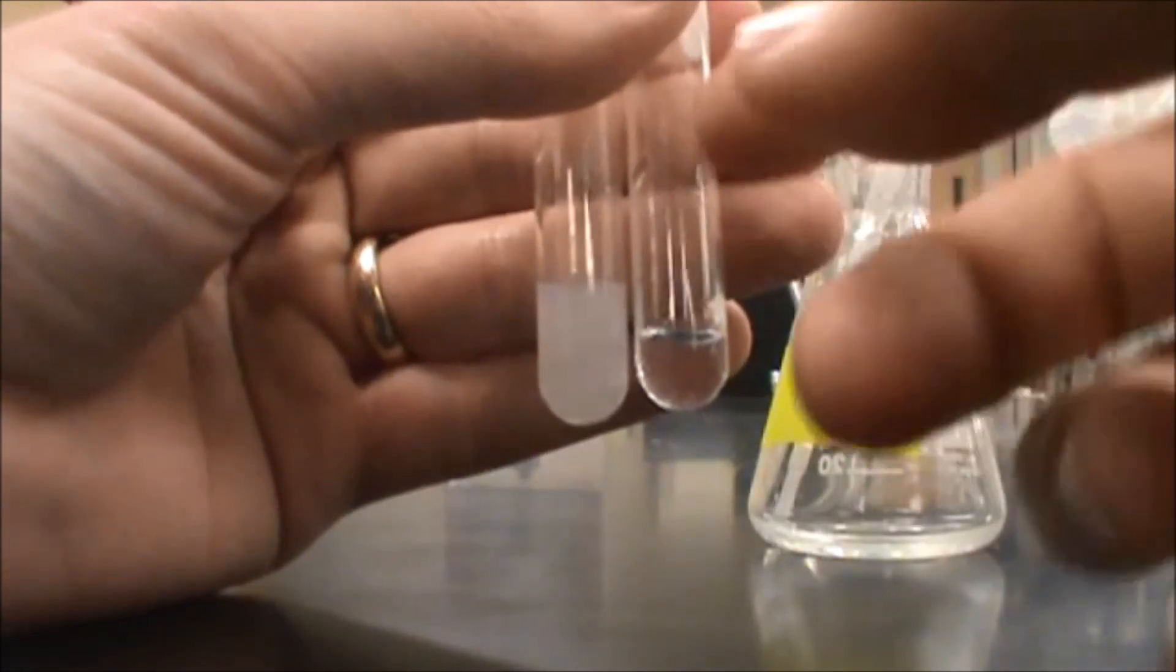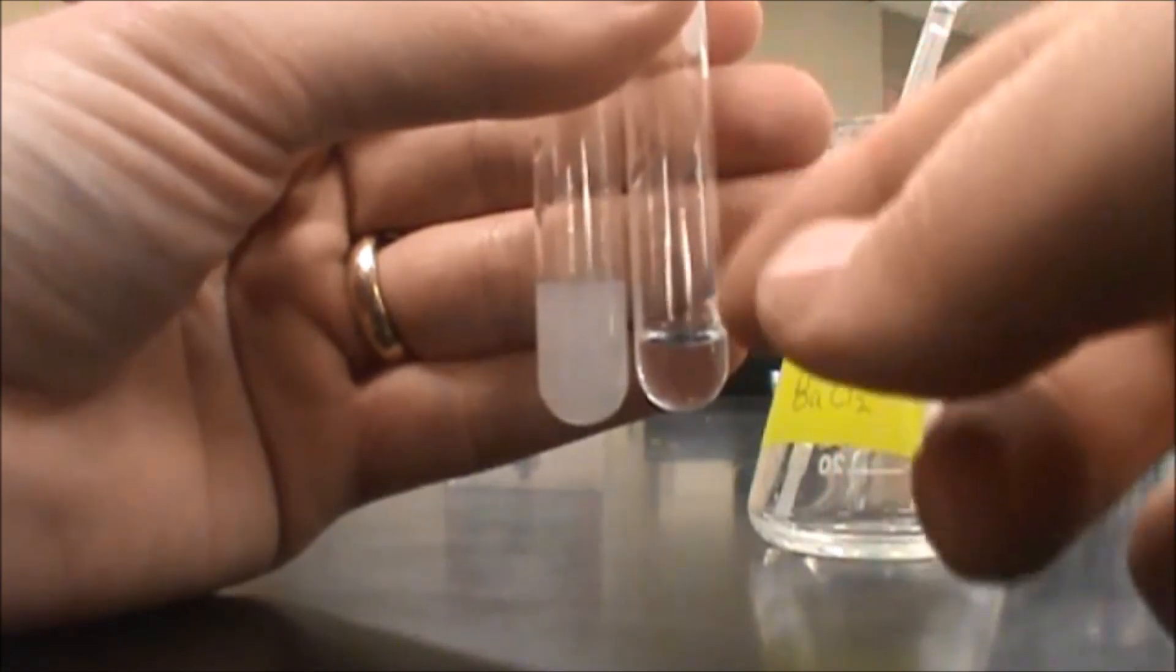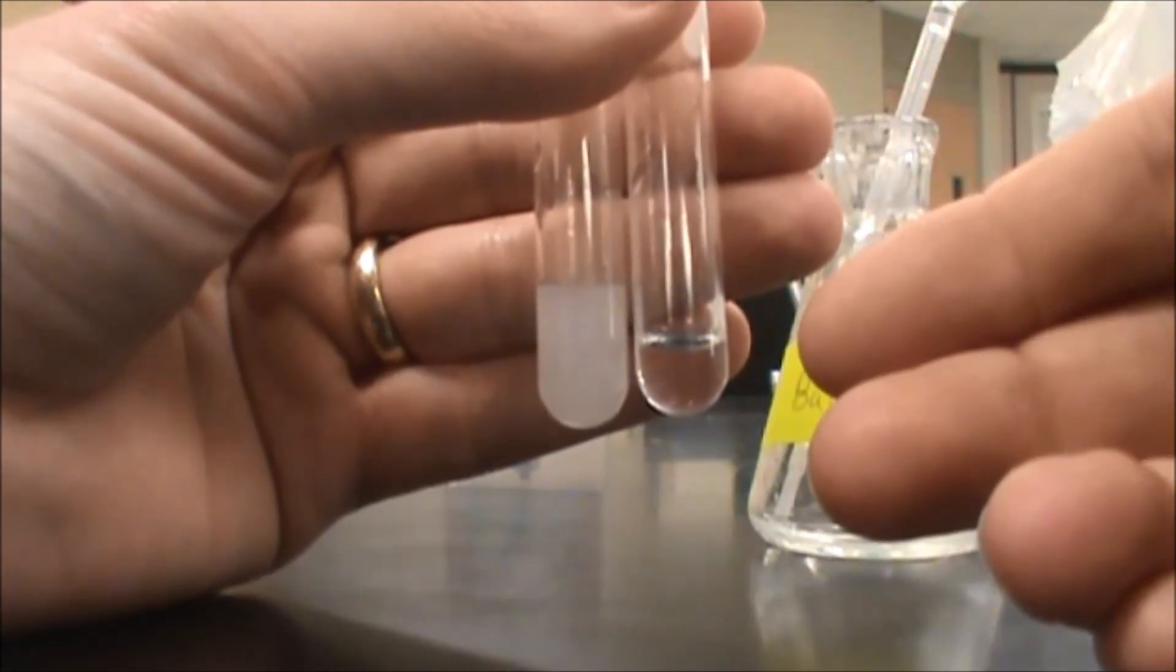And then I would move on to the other one. And if these had matched and this had stayed as a precipitate, then I would have known that I had a sulfate.